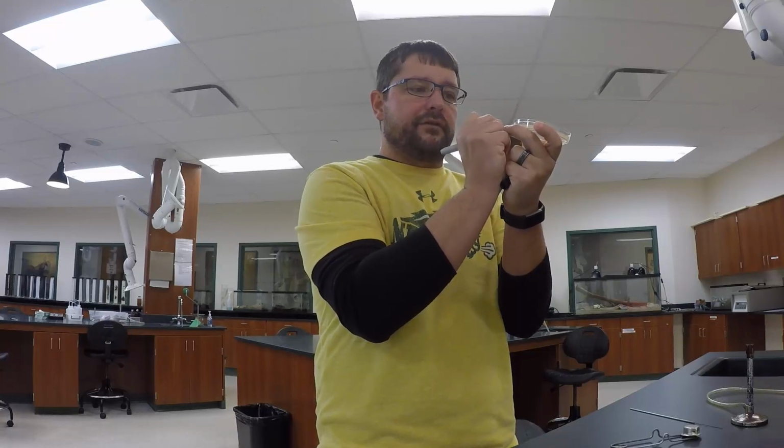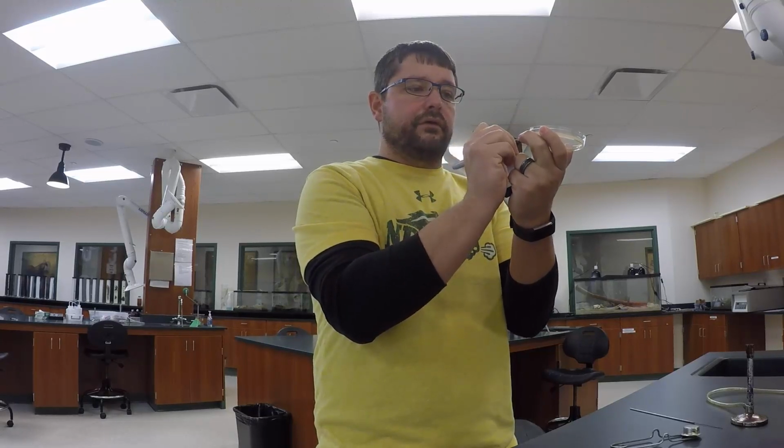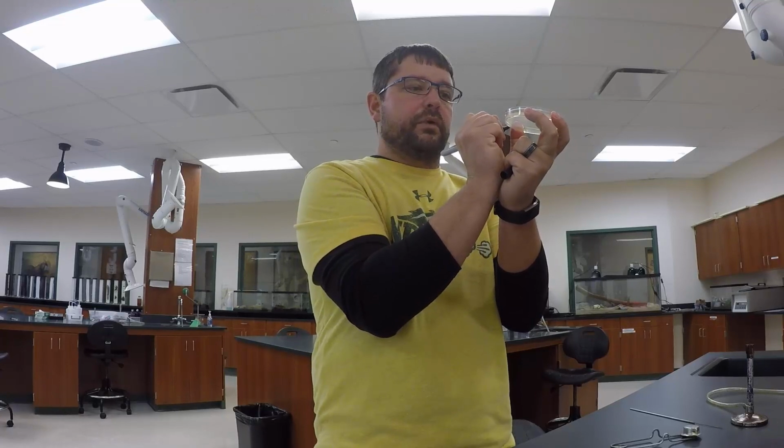Okay, so what I'm going to do is take the top off of this, and I'm going to write what time I took it off at and today's date on the edge of this, so I then know the date and the time, and then I'm also going to write that this is an exposed plate. And I'm just going to leave it sit there on the table, open, for however long it takes me to do this lab. And that'll be about an hour to complete all the tasks in the lab, and that should give me a fairly good amount of time for that to collect bacteria and fungi and other things that are just floating around in the atmosphere in a lab.